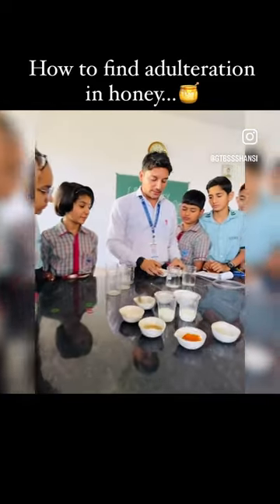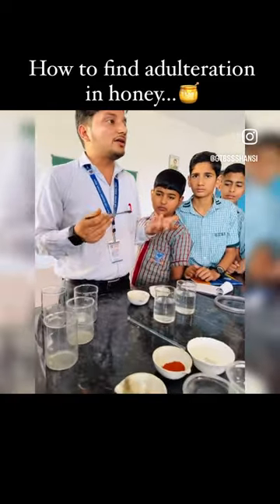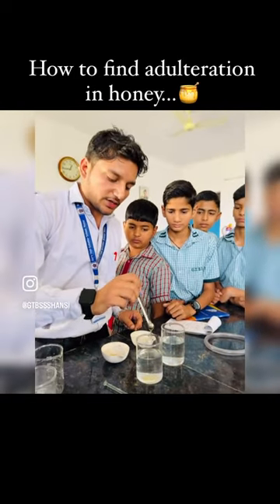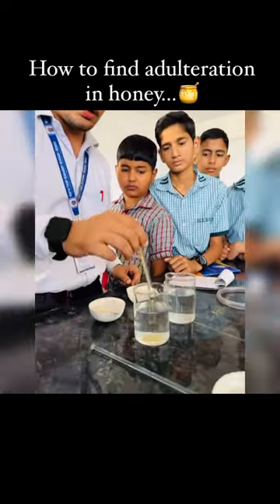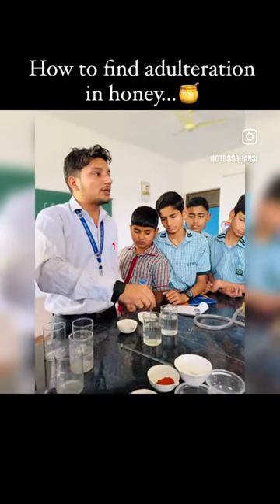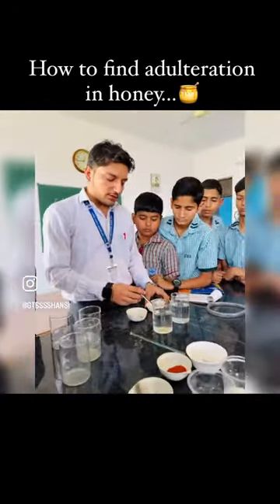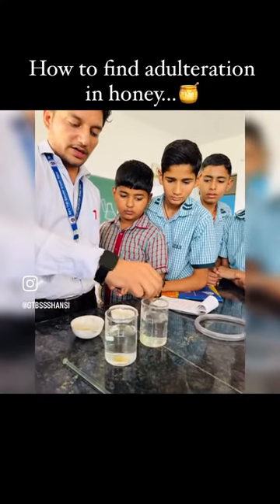First of all, we are going to talk about honey. In the market there is a lot of adulteration. We add a pure sample to the water to dissolve it. You will see that it is lying down and it is slow to dissolve.